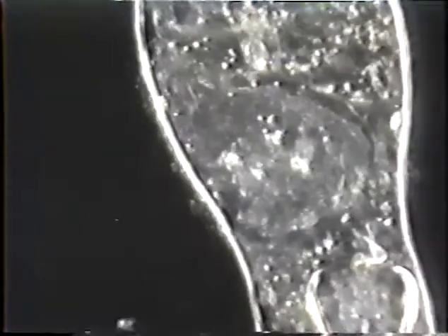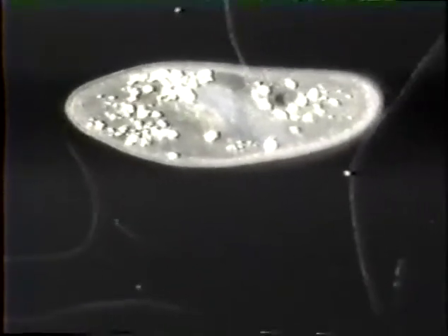At this point, he's pretty well self-digested his entire interior. Again, I believe this is due to lysosomal rupture. This entire process from the start of exposure to approximately this point was about 30 minutes.